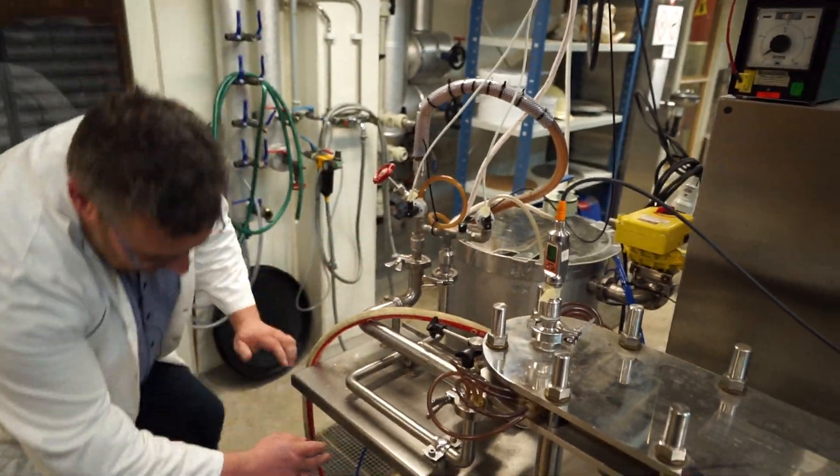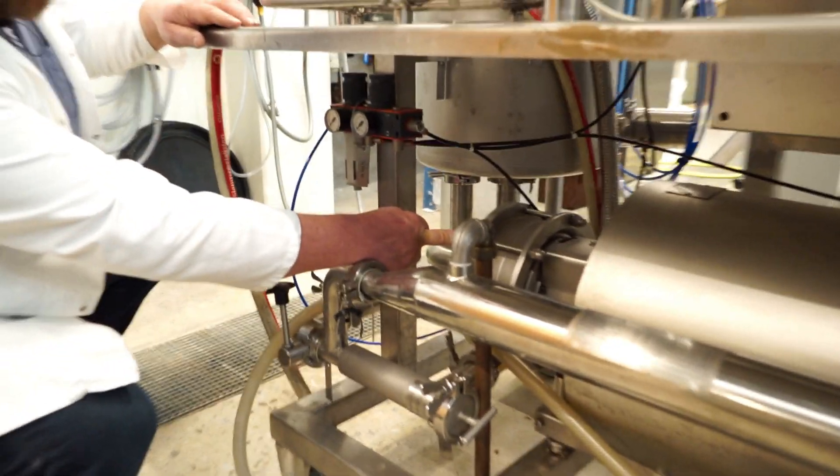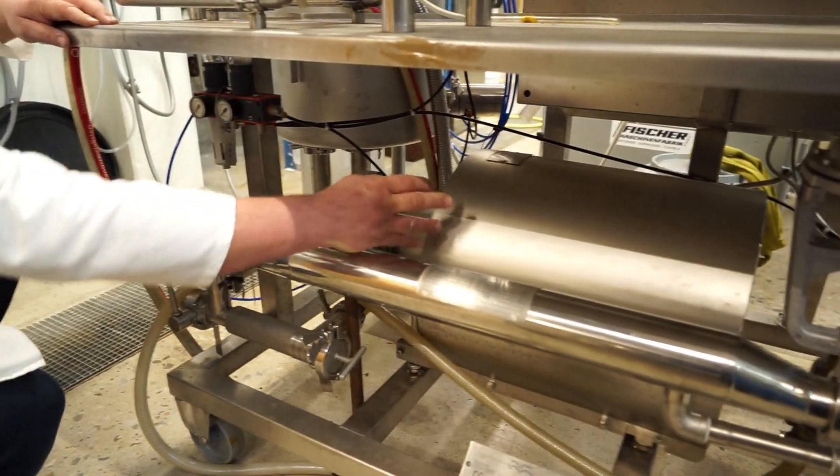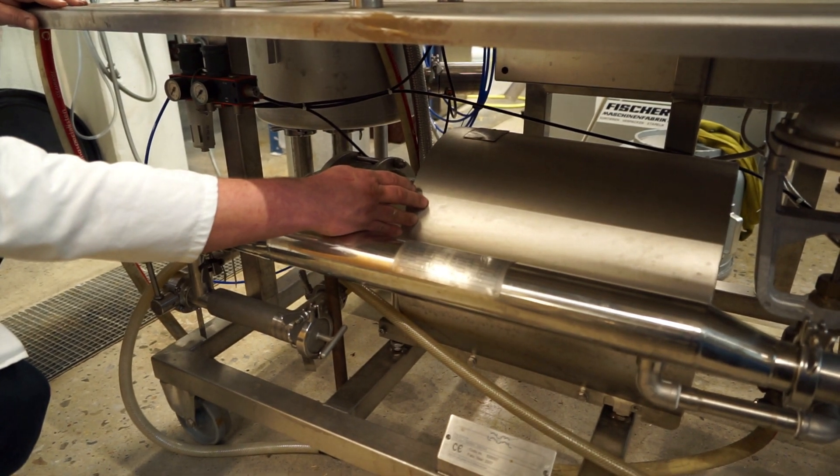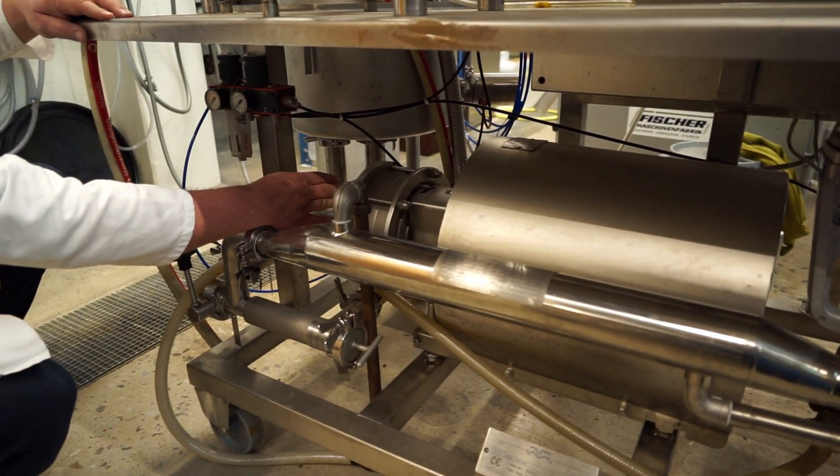From the feed tank, it goes into the pump. And this is a centrifugal pump. This here is the engine, the big one there, the big one that drives the pump.